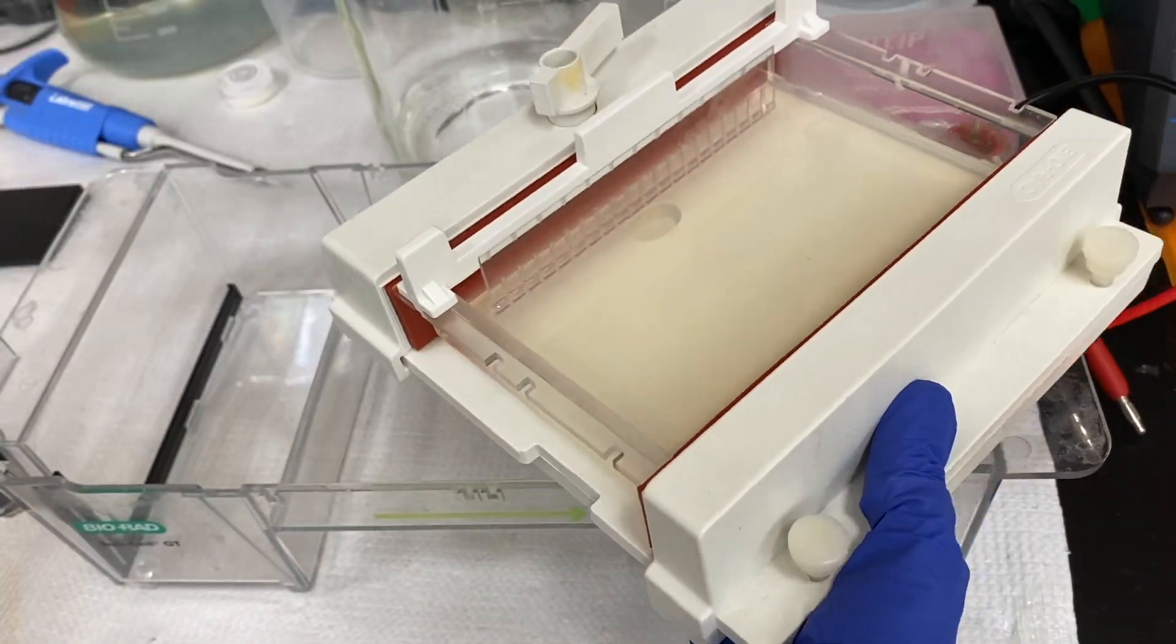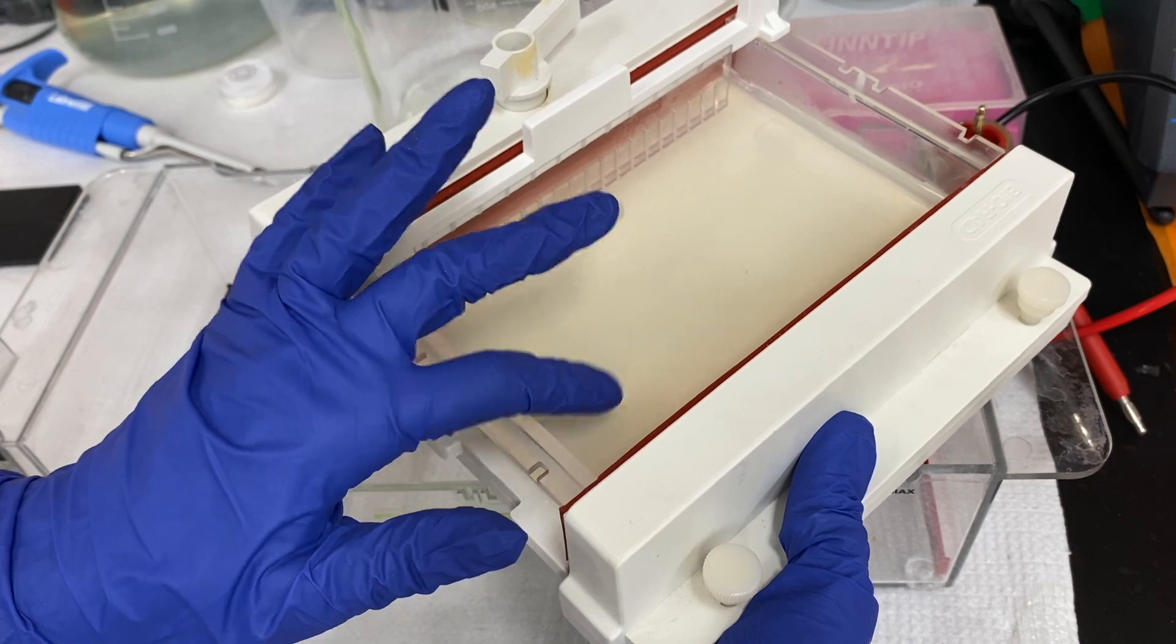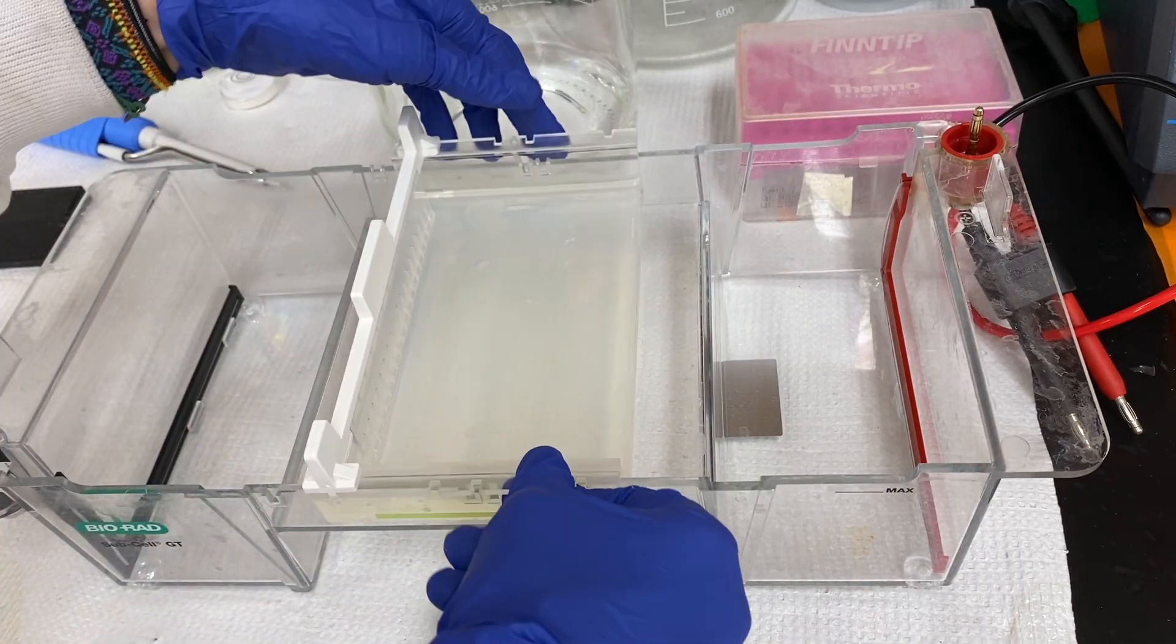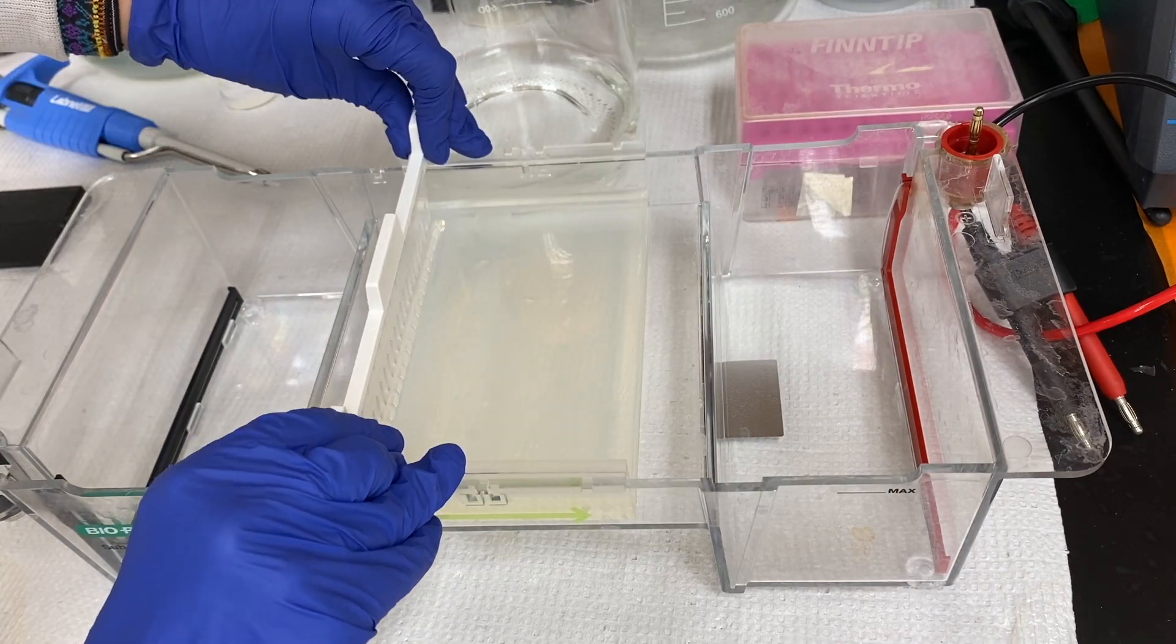Now that the gel is solid, I transfer it to a plastic tray attached to an electrical rig. Once I remove these prongs, you will be able to see the wells that they made in the gel where the DNA will be able to sit.